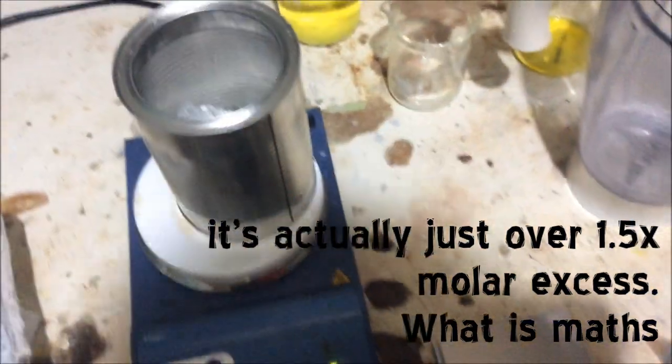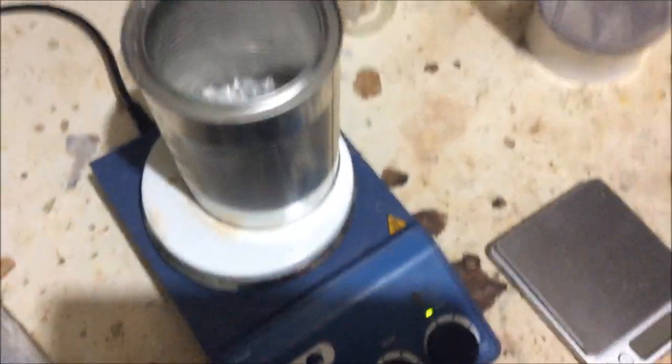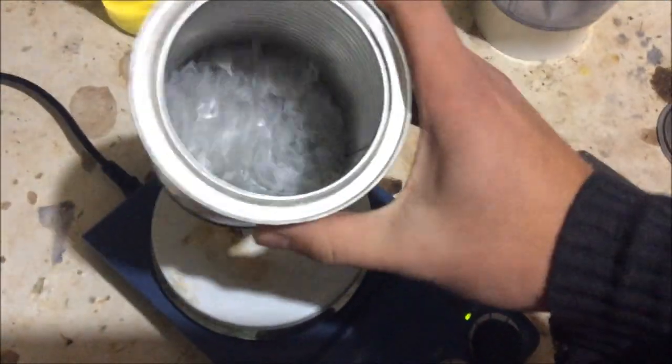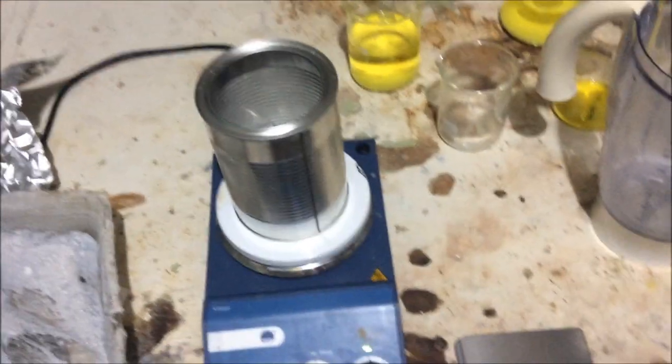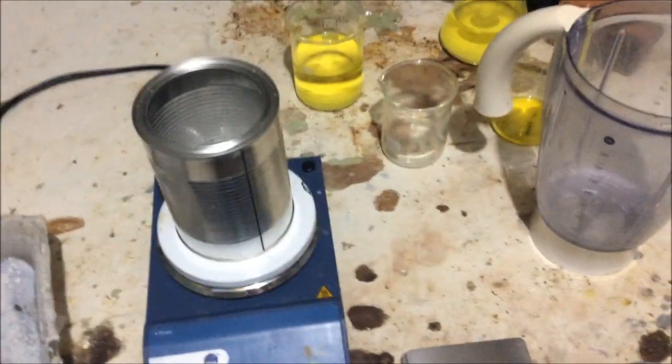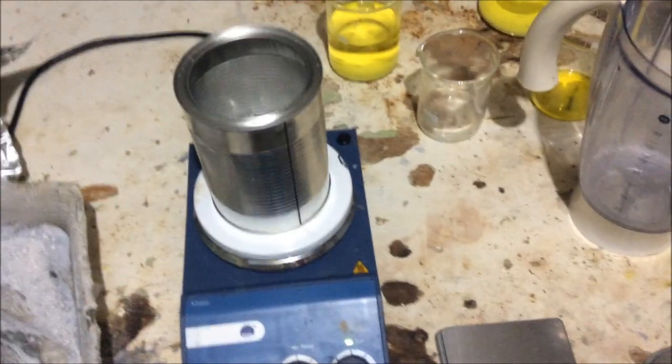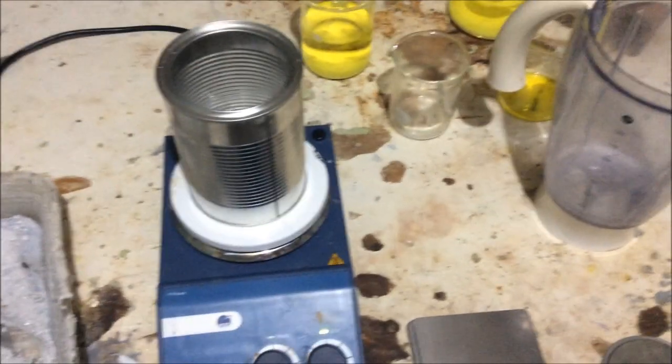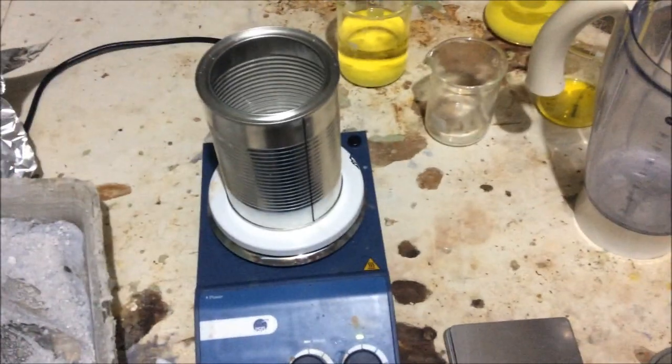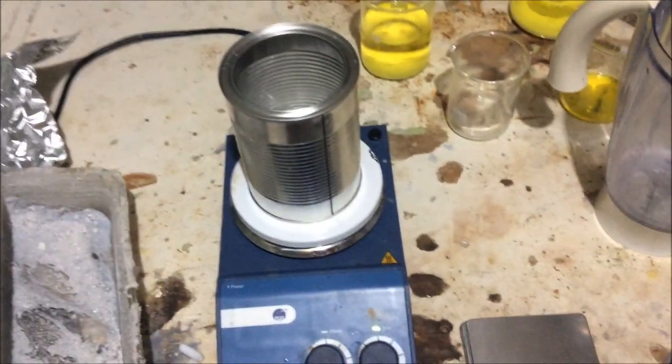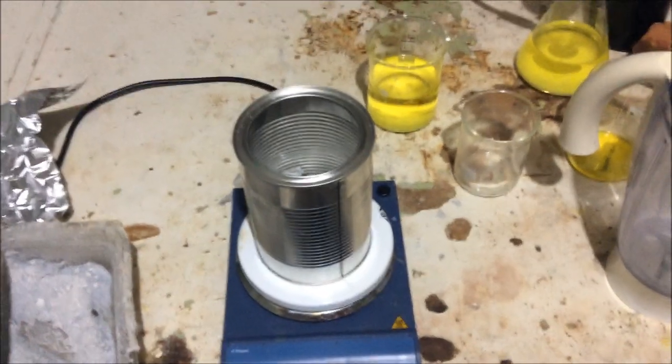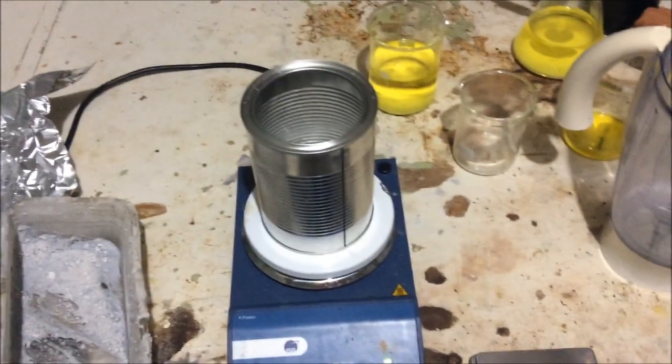Now, one of the big issues with this reaction is that we have quite a concentrated solution of sodium hydroxide at reasonably high temperatures, 200 or so degrees. And I'm fairly sure if I ran it into a glass, it would etch the glass pretty seriously. In fact, probably destroying it or really seriously frosting it.